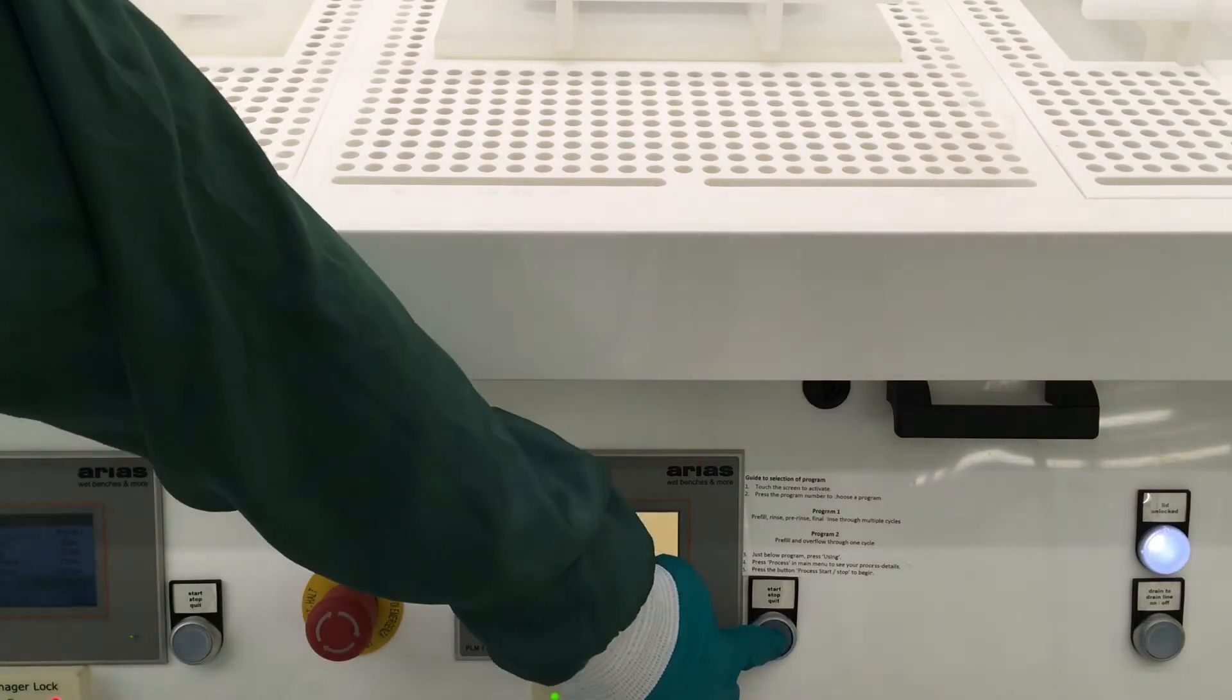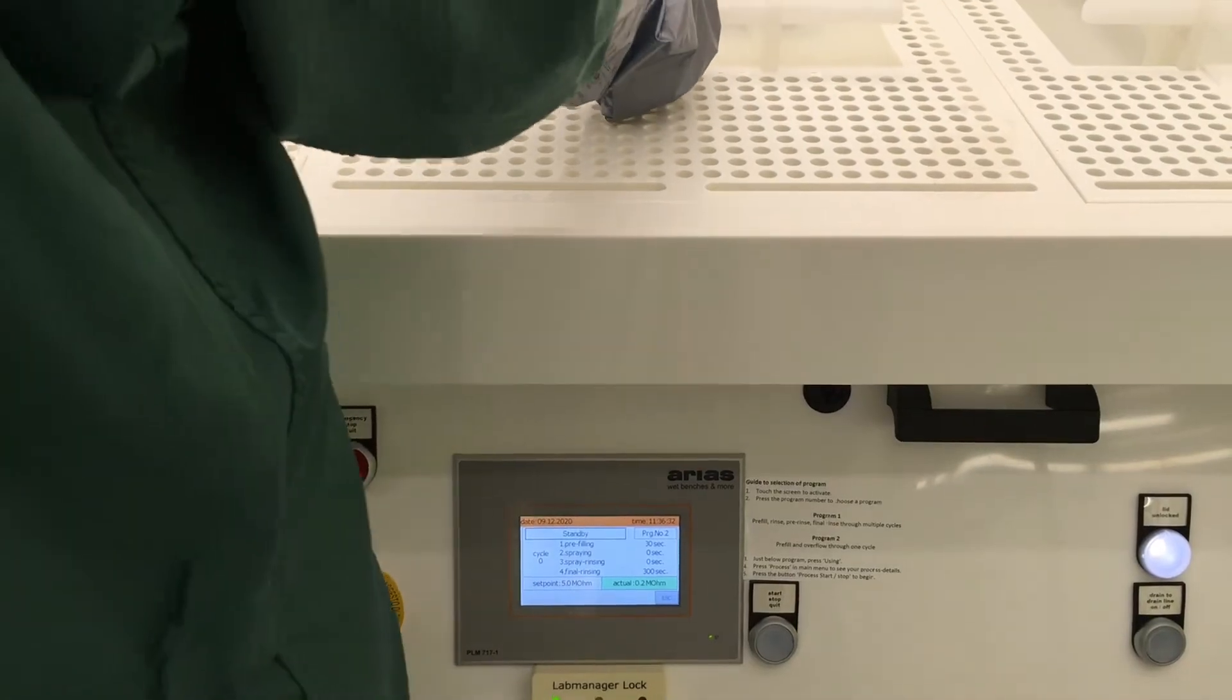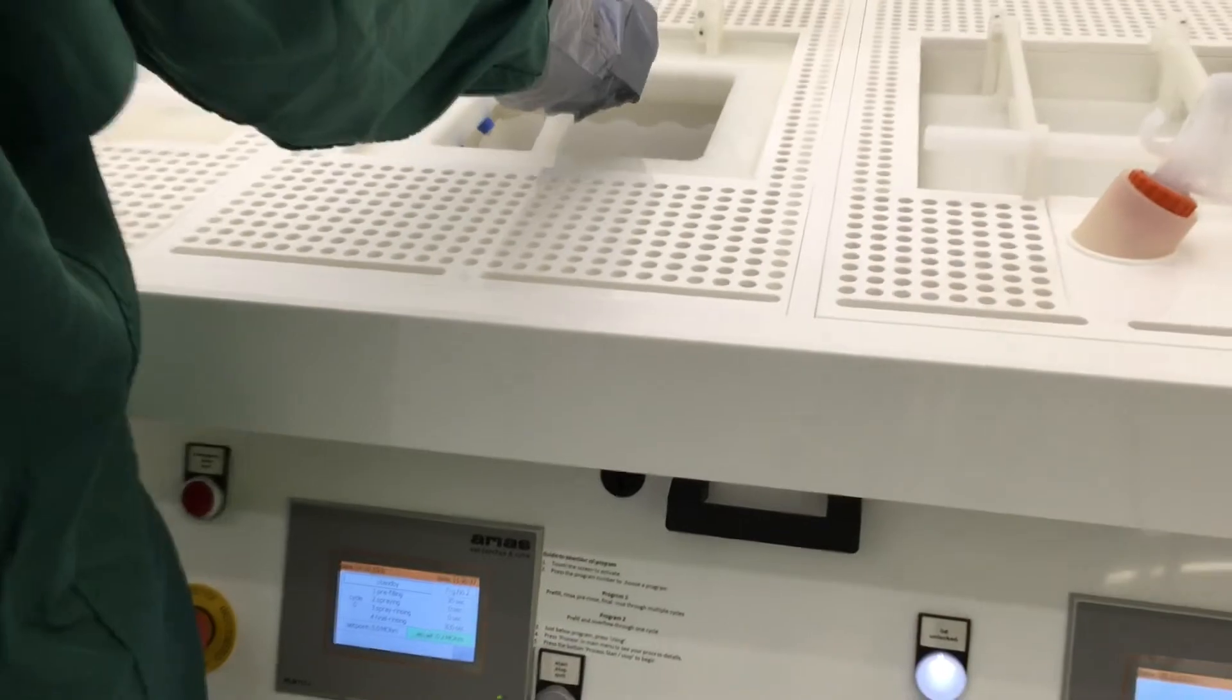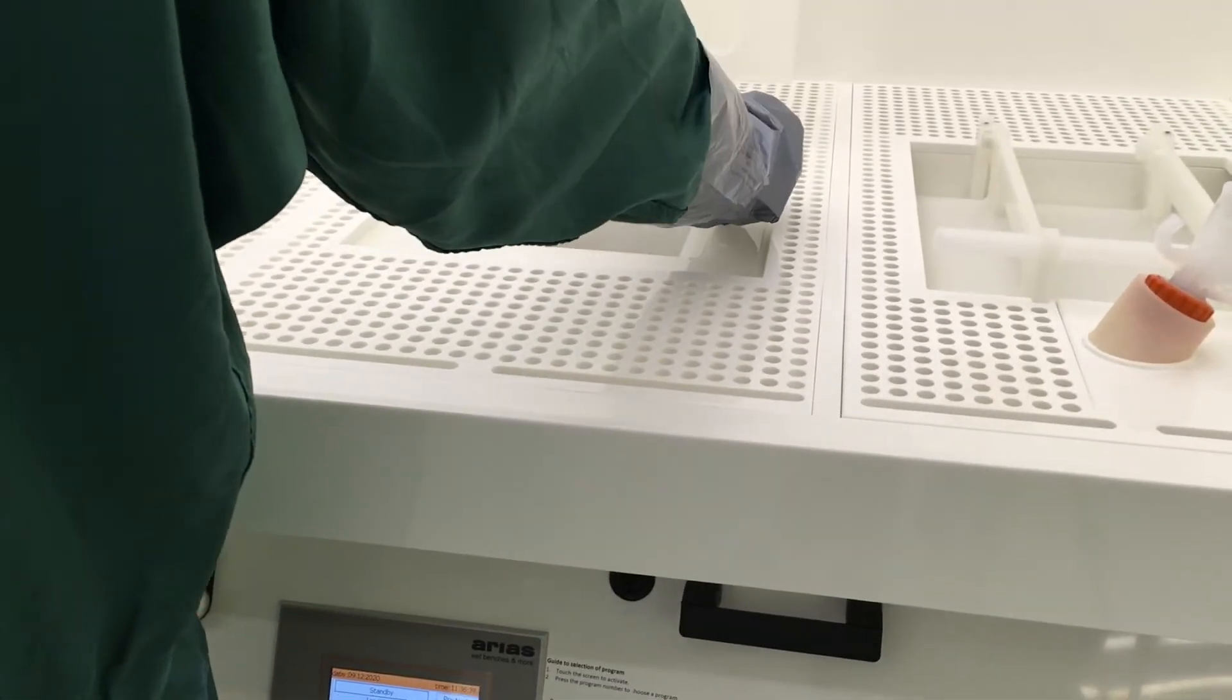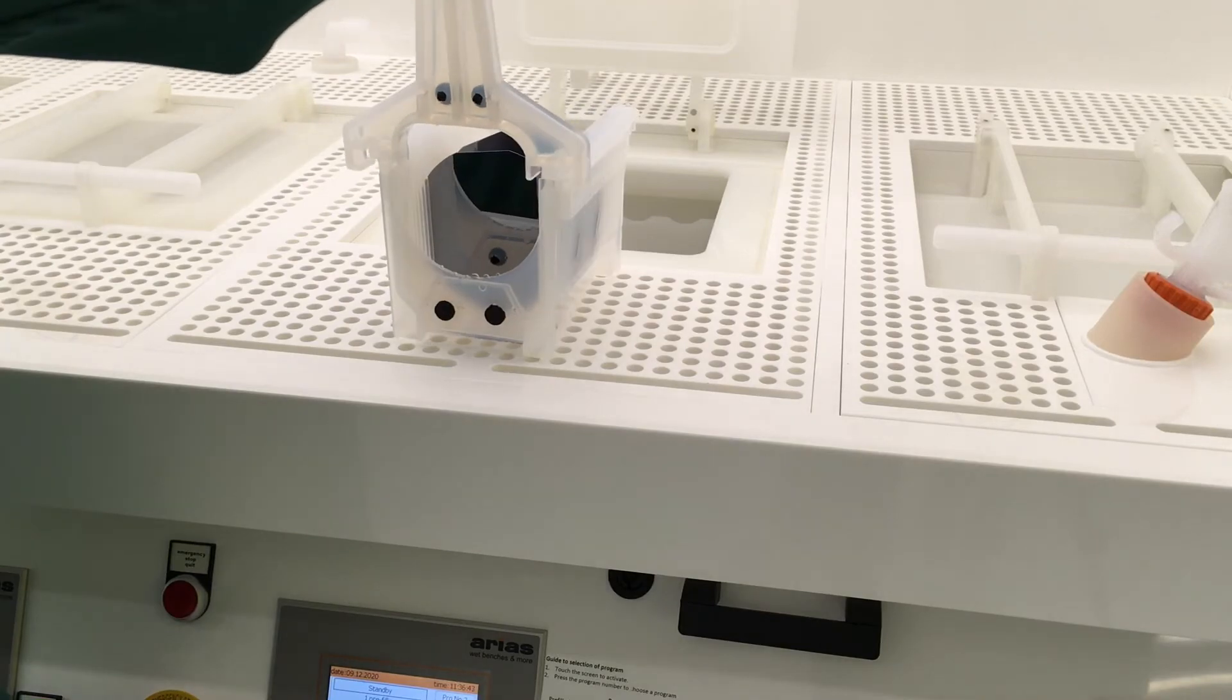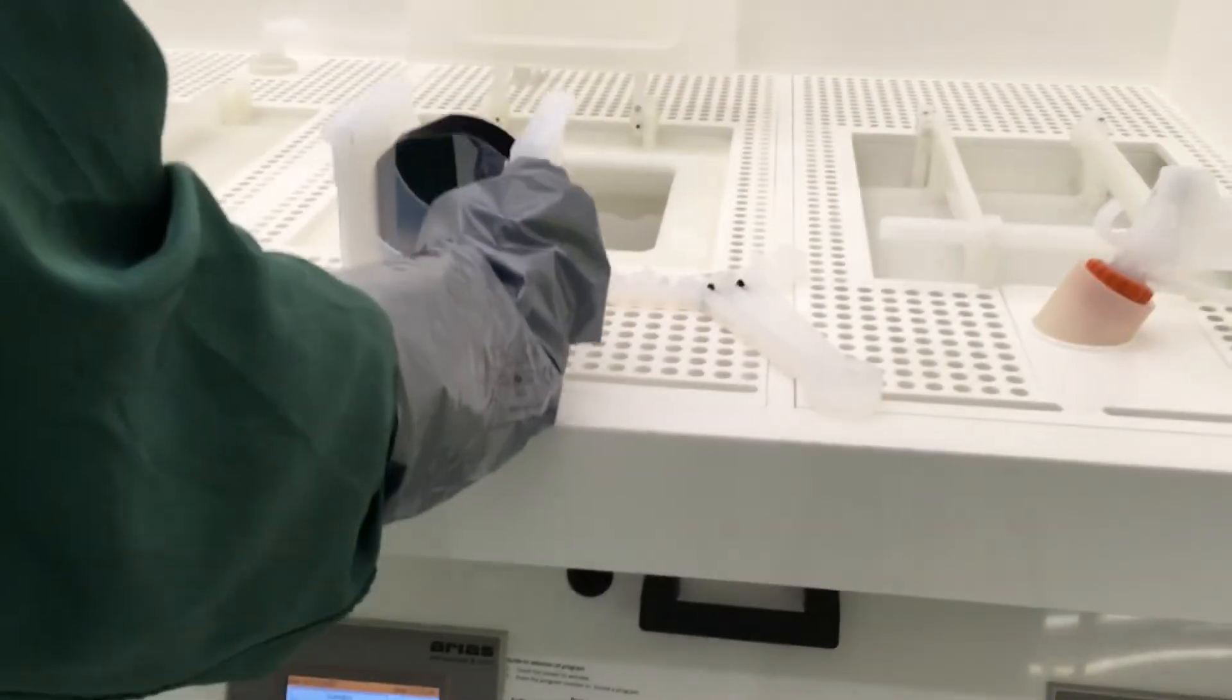When the rinsing is finished, we will pick up the wafers and place them in the dryer.